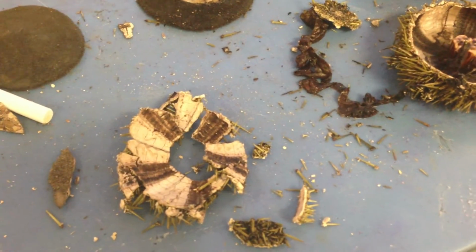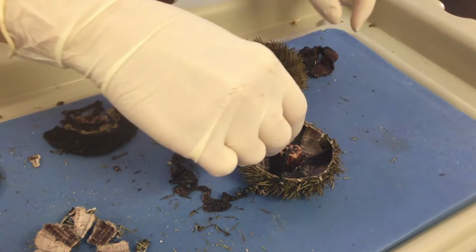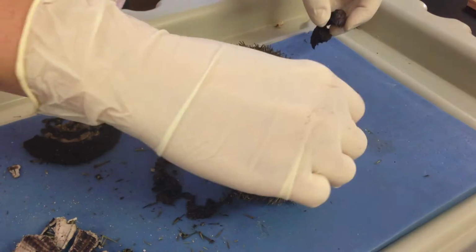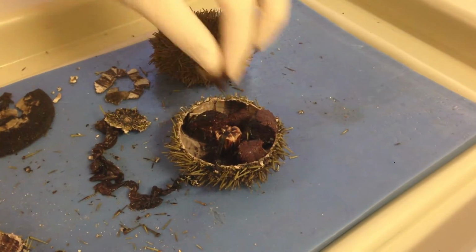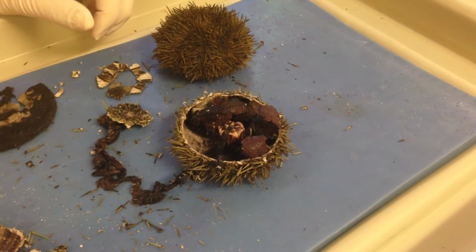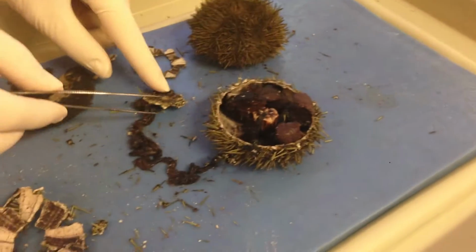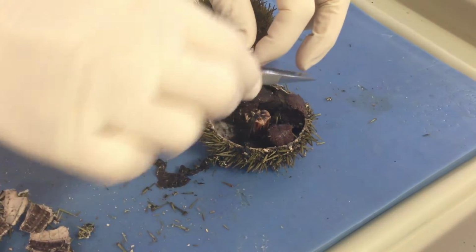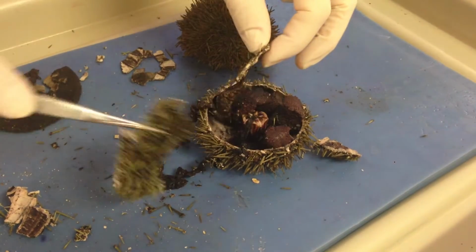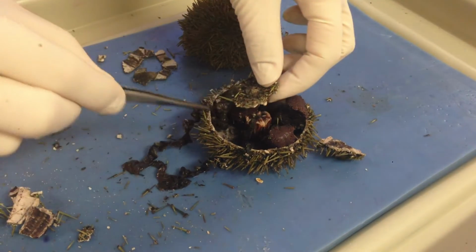So when you are done opening this up, inside you're going to find a whole bunch of these structures all lined inside. What do you think these structures are? Those are the gonads. That's right. There's going to be a whole bunch of gonads. You want to be very, very careful. So you're going to peel off this top piece and then carefully peel around so that you pull off these particular structures, leaving this all intact.